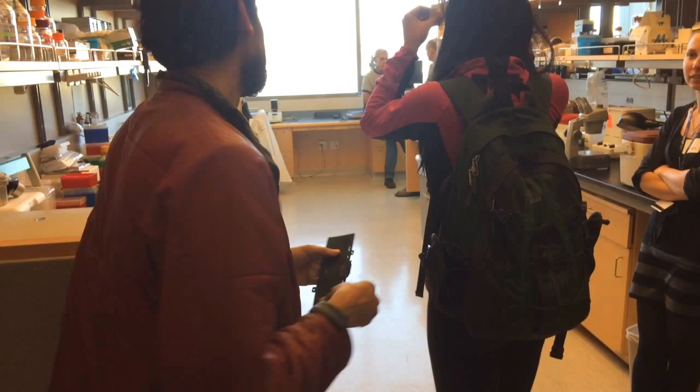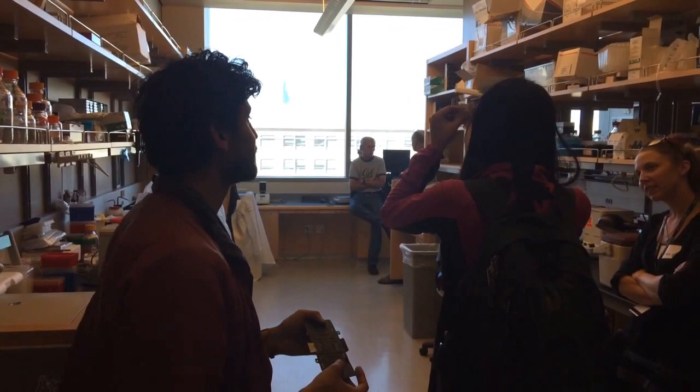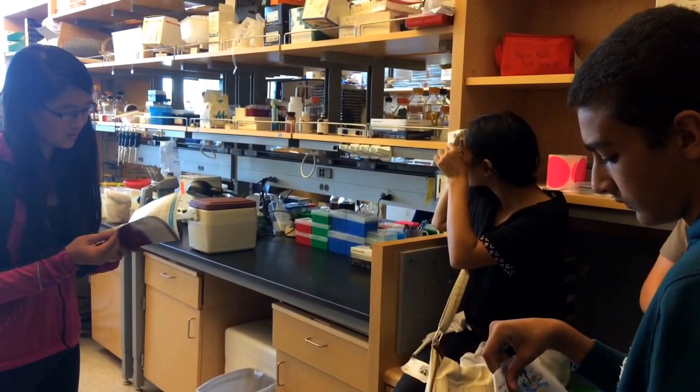What do you see? Yeah, the black stuff. You should see black dots. But the black dots have a lot of structure, and that's carbon. So that's going too far. Awesome. So you don't have to bend it that much.